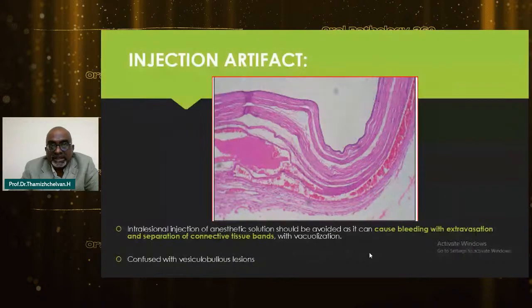Let's go to the artifacts happening on the surgical or clinical side and how to avoid them. Injection artifact is another very commonly seen artifact in our day-to-day practice, and this can be confused with a vesiculobullous lesion because infiltration at the biopsy site can cause bleeding with extravasation and separation of connective tissue with vacuolization. So at times, it can be confused with a vesiculobullous lesion. To avoid this, please recommend that the surgeons give a block to avoid infiltration.